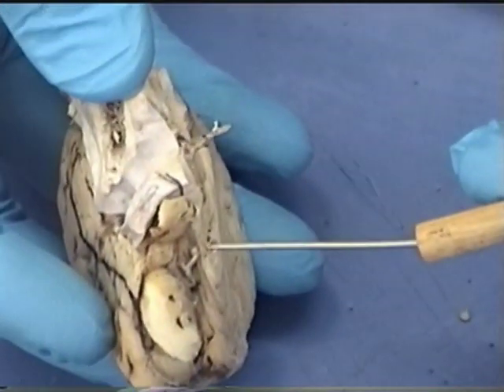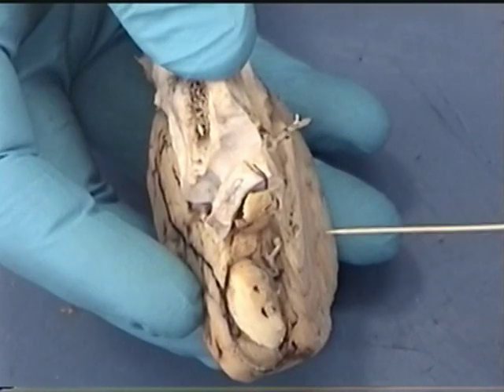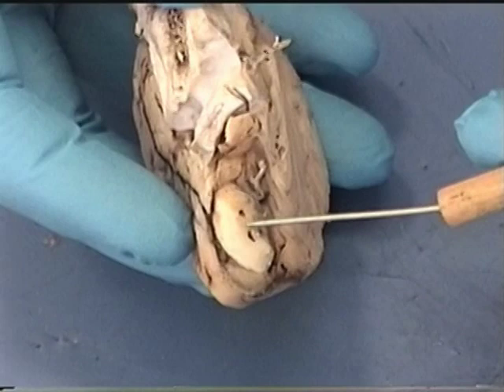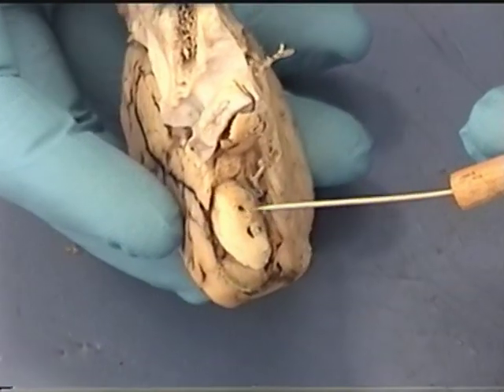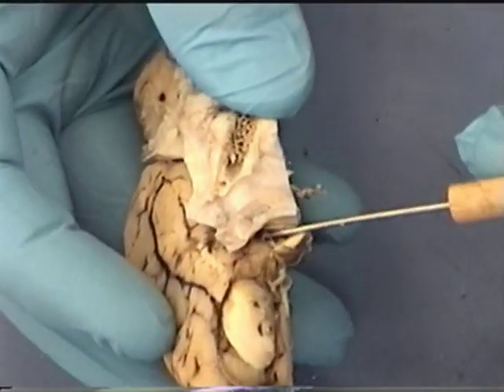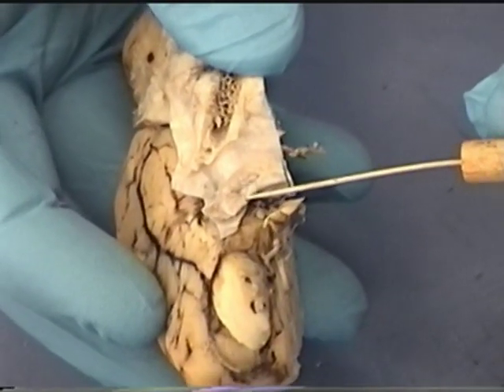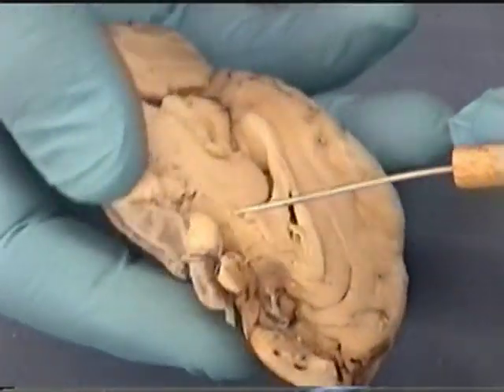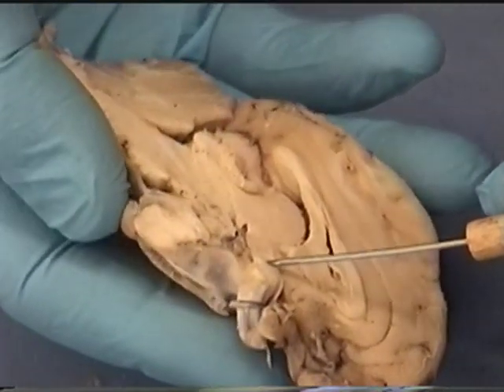As we look at cranial nerves, we're only going to cover four on the sheep brain — the others are fairly difficult to find. The olfactory bulb is where nerve one becomes part of the brain, so the olfactory nerve is associated with the olfactory bulb. This nerve that's been cut was coming back from the eye — that's the optic nerve. Part of the optic nerve crosses, so this structure here is called the optic chiasm.